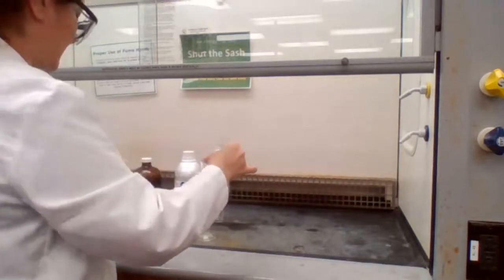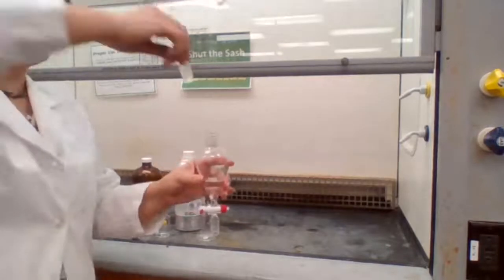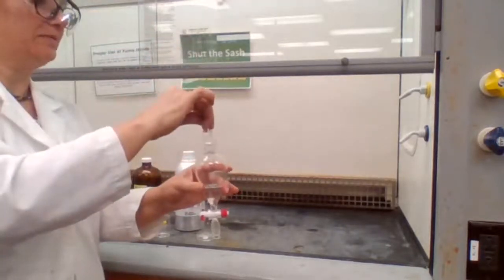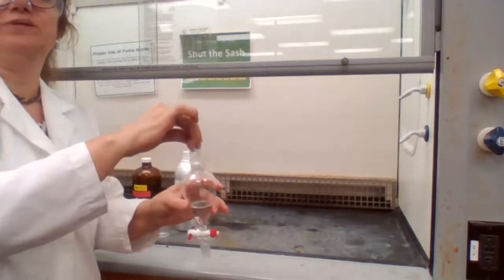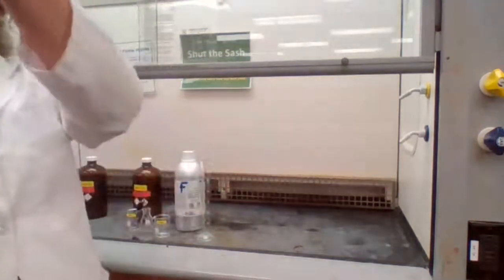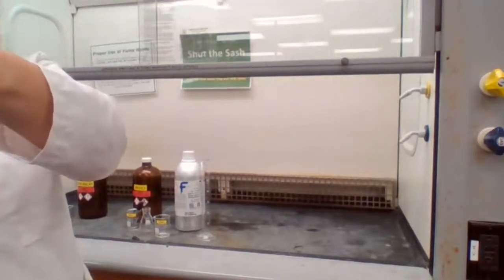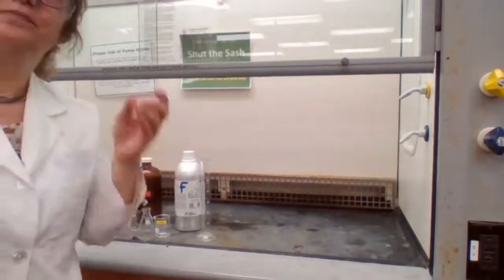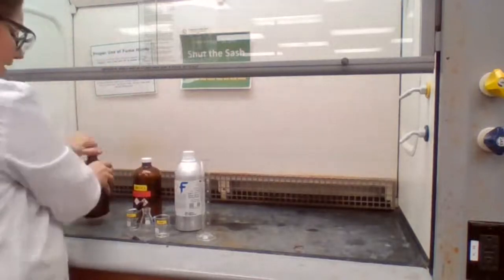Can you tell me what's the next step? What do I need to add next? How much sodium hydroxide do I have to add? You have the procedure, right?